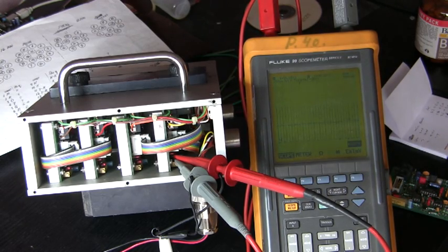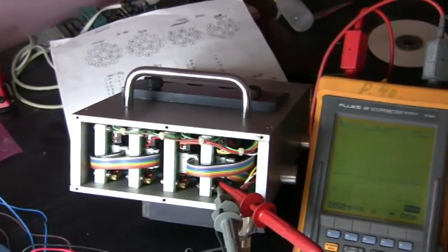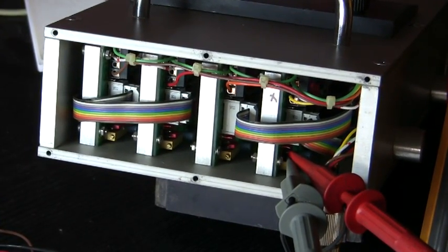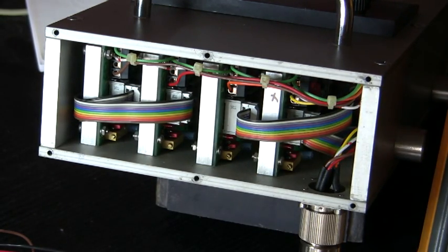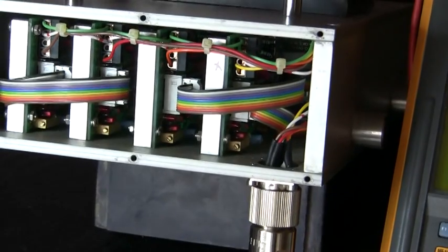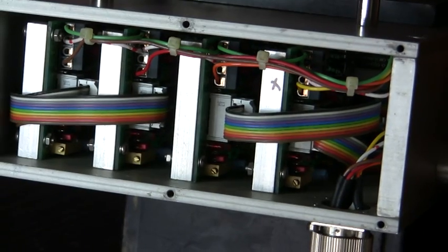What we should also check is those red LEDs and those boards, because sometimes these boards generate ghost counts. Ghost counts are a nightmare, because you get undercount in your bottles and you get no clue where they come from. I have seen that this particular board does indeed show ghost counts — not often, maybe once in a couple of minutes, but it does. So let's just leave it here and wait and see.